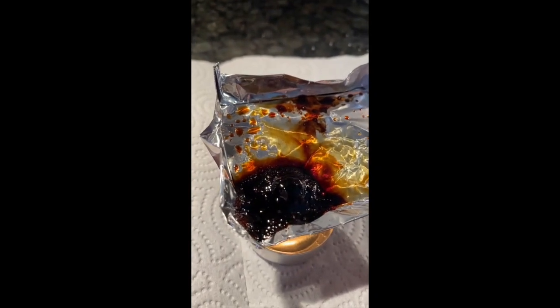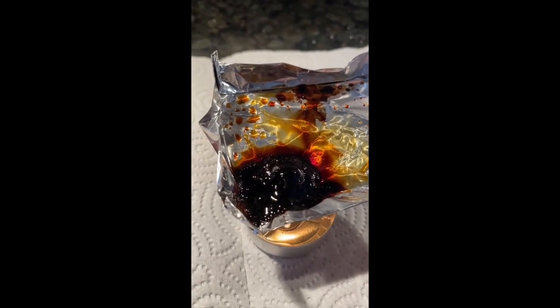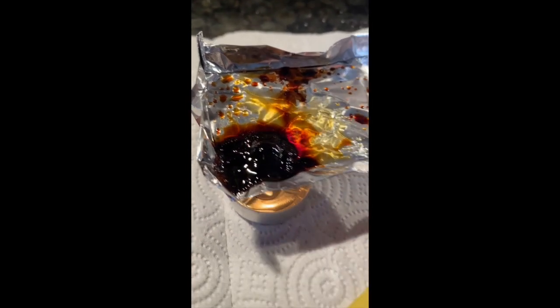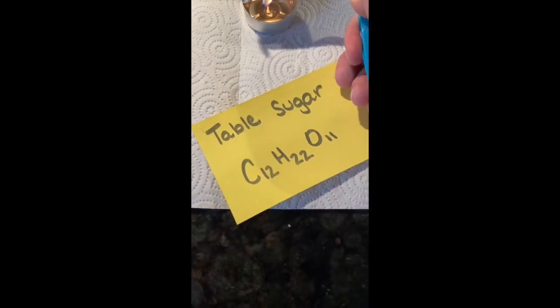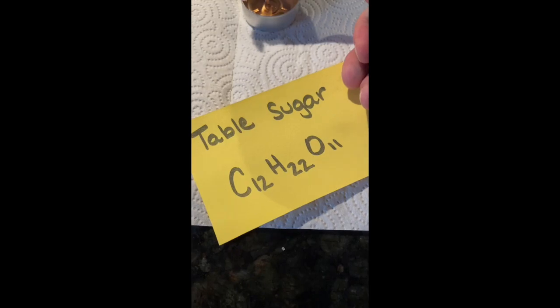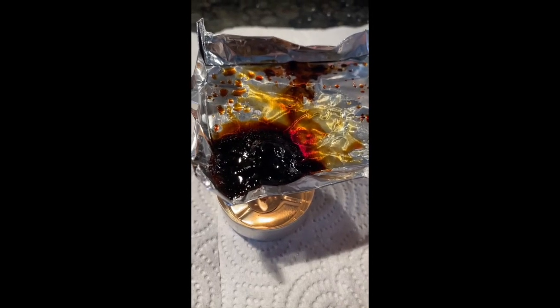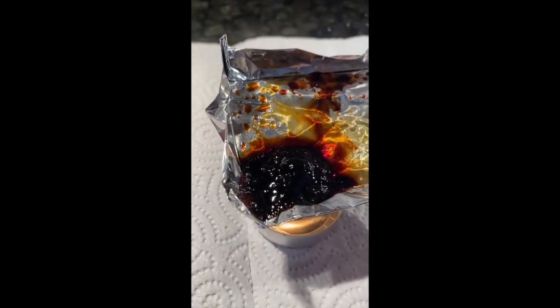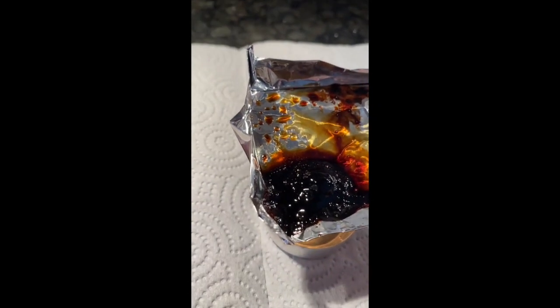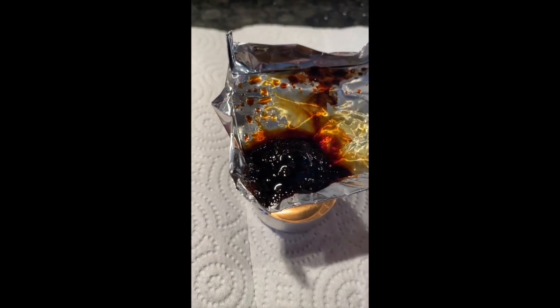Your goal again is to decide if it's physical or chemical. We could have a little bit of both going on. And keep in mind, we just used table sugar. We have our chemical formula there, C12H22O11. So that's just carbon, hydrogen, and oxygen, three of our big main elements of life. And you got to see the sugar go through most of the changes. Again, I didn't keep the camera on there the whole time. You guys would have been watching this forever. But you saw the big main parts of it, and this is pretty much our ending product.